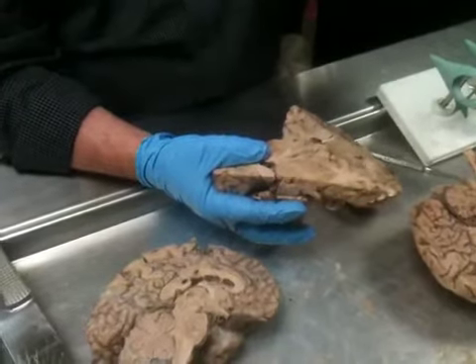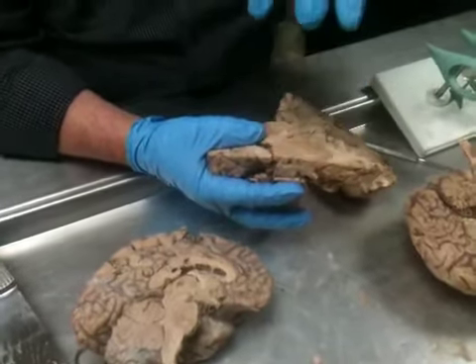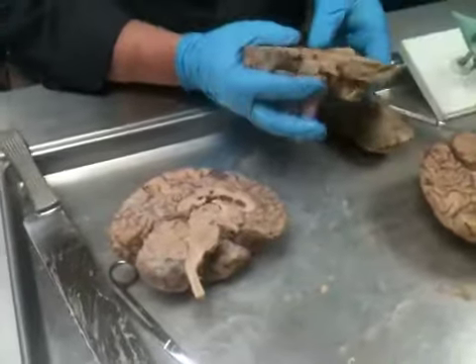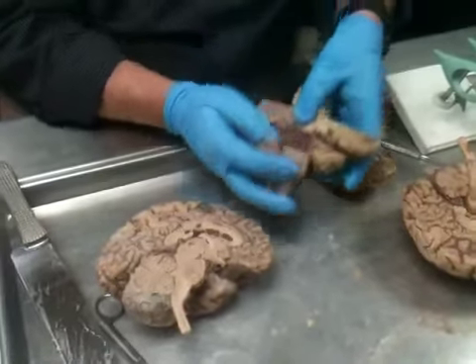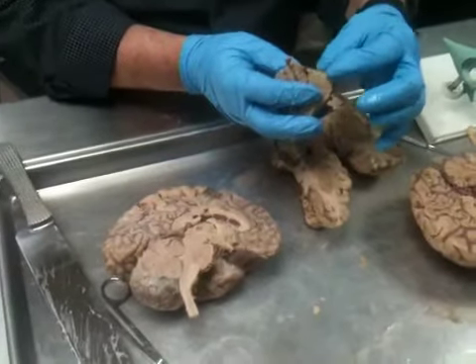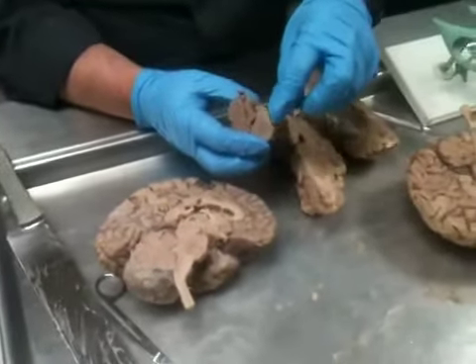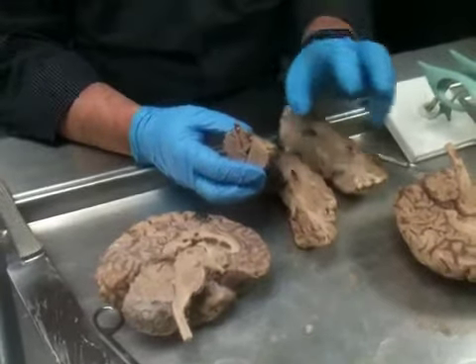there are also fibers that are coming down, and as they continue to go down, they start to collect, kind of like the bell of a funnel coming down to the point of a funnel. And at the point that they travel through this part of the brain, they get to now all be collected as a cerebral peduncle. So the internal capsule, as it continues down, becomes the cerebral peduncles. Okay?